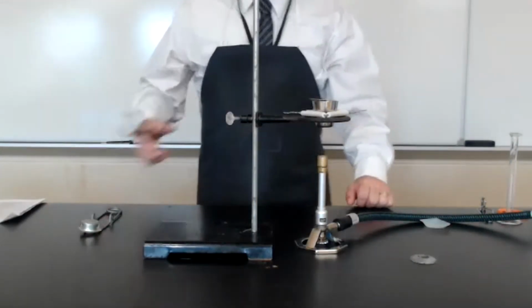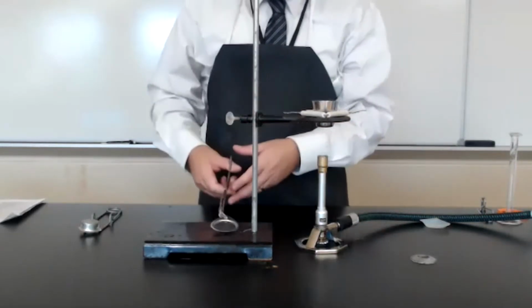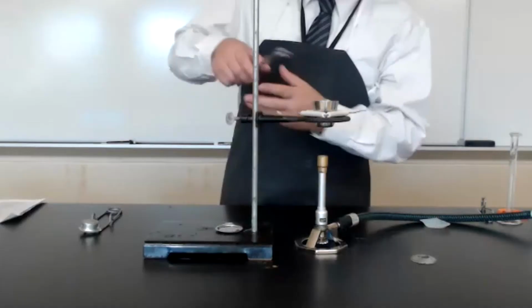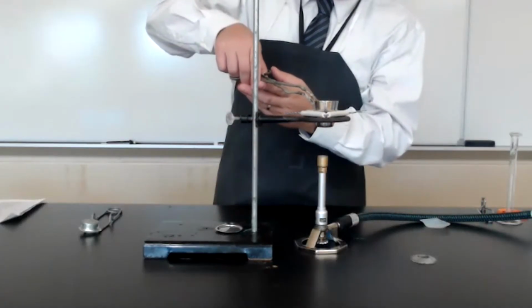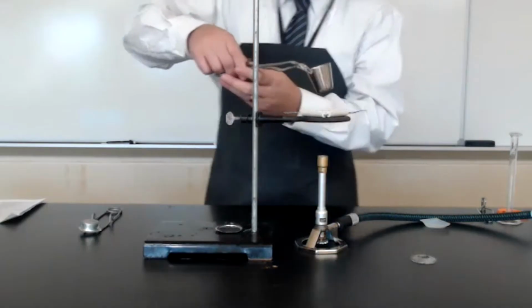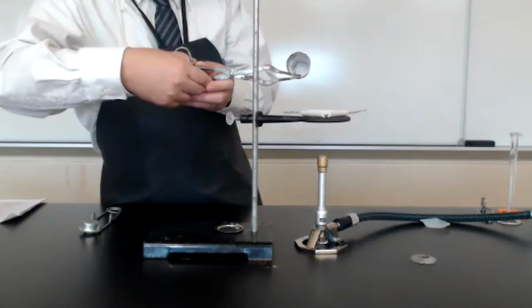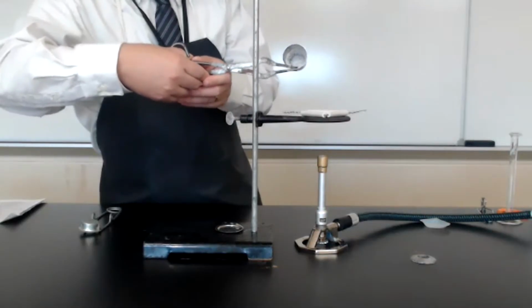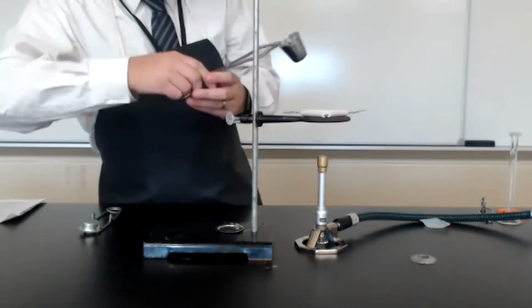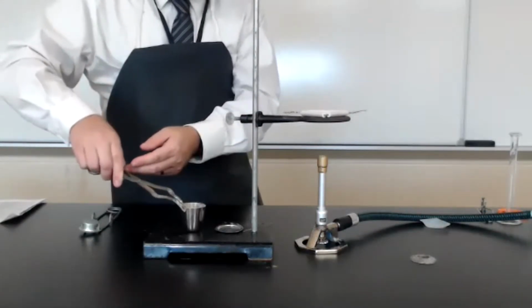Use a pair of crucible tongs to transfer the lid and the crucible to the base of the ring stand to allow for it to completely cool. The inside of the crucible now has our dried sodium chloride. All of the water has been evaporated, and we've recovered the sodium chloride, and that is now coating the interior of our crucible.